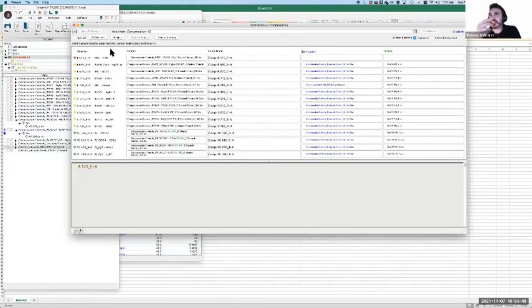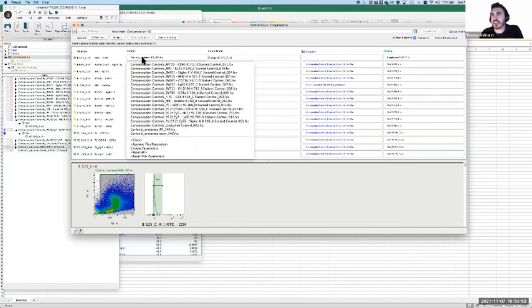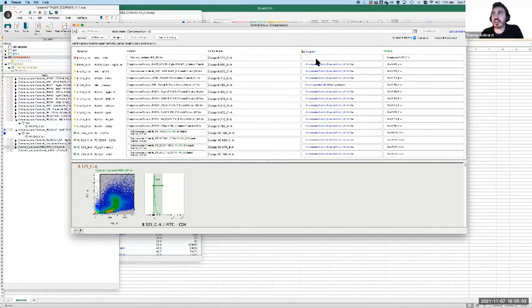Oh, actually, you know what? There is a way to do it. If you like, you can assign just a sample as the positive control for that color. So let's say I didn't have anything in FITC, I could just assign a color there. I guess it would have to have a positive of some kind, because what that's going to calculate is just the contribution of that to everything else. And so I can say, okay, well, FITC is actually contributing 0 across its row because it doesn't have any color, and then just keep the column info.